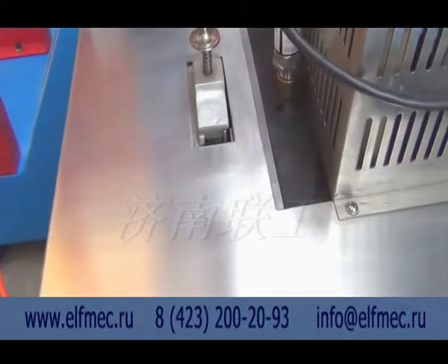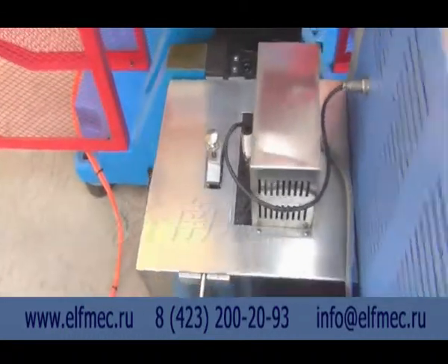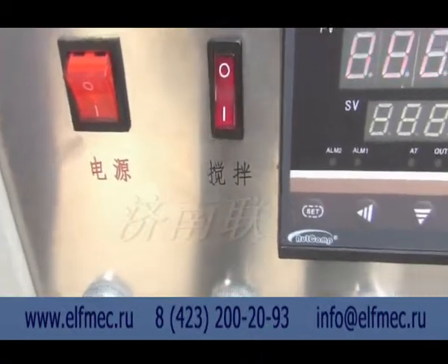Put the sample box into the guide slot, open the low temperature control power, open the stir button, take out the sample box, and check the liquid stir condition.